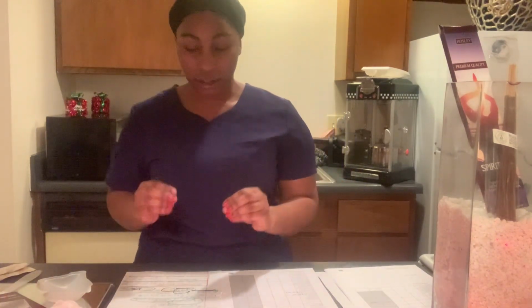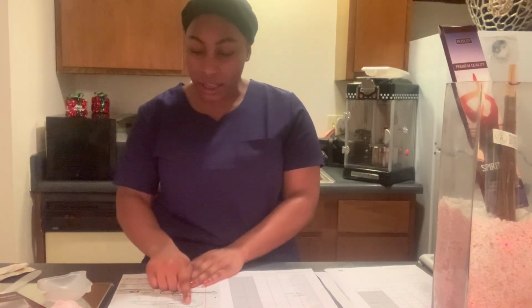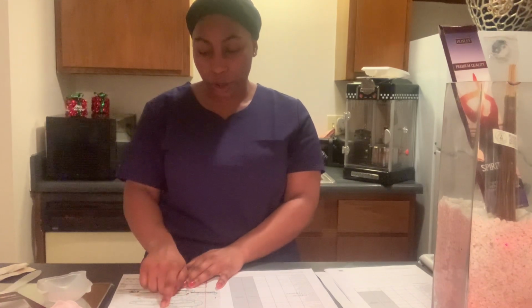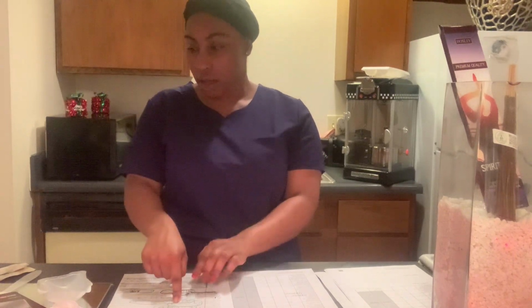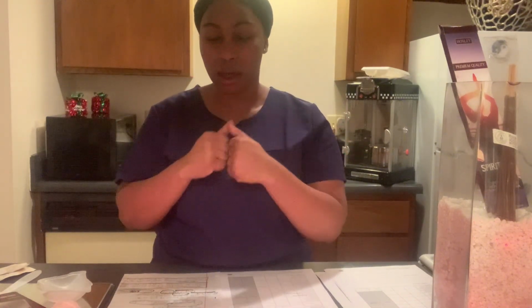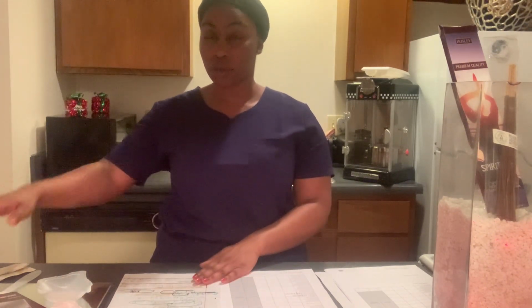With our calculations, we need 1/2 of the amount, which is 30 grams. 5% is 50 milligrams per gram. So 30 grams is needed. How we got that information is what the course itself explains about the prescription and preparing the actual drug.